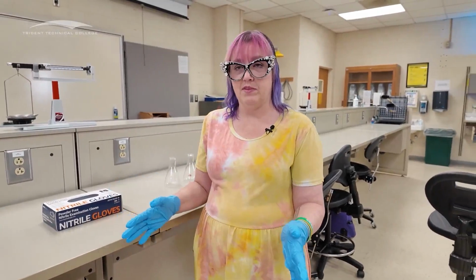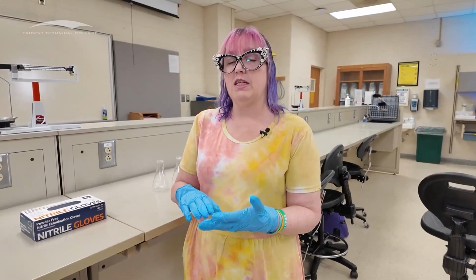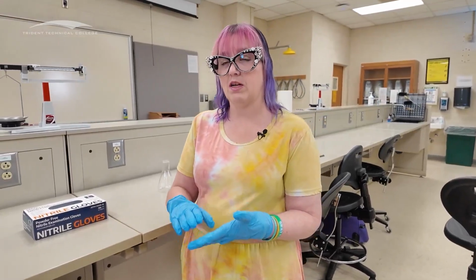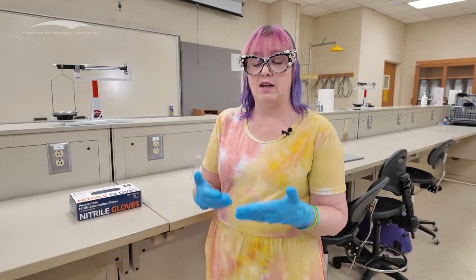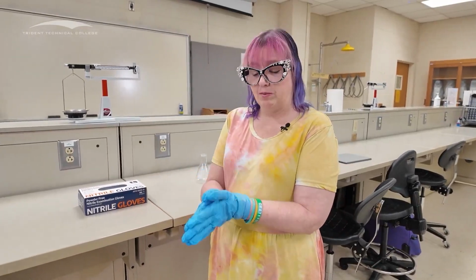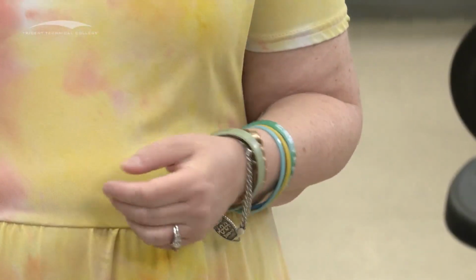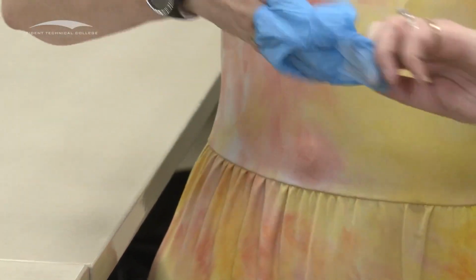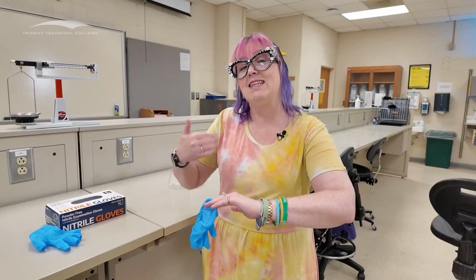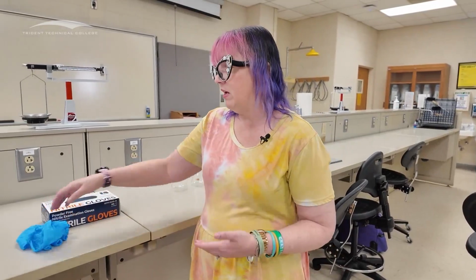When I'm in the lab and I'm working with these gloves, everything is fine. If I have to leave the lab for whatever reason, I need to go to the bathroom, I need to take a phone call, I need to eat something, I need to do something outside of the lab, including taking a drink, then I need to take these gloves off. I can take the first one off fairly easily, right? But when I go to take the second one off, I want to hook my fingers inside of it, grab a hold of the inside, and then pull it off like that so that I'm holding the inside when I'm dealing with it, not the contaminated outside part of the glove. And then I take those off.